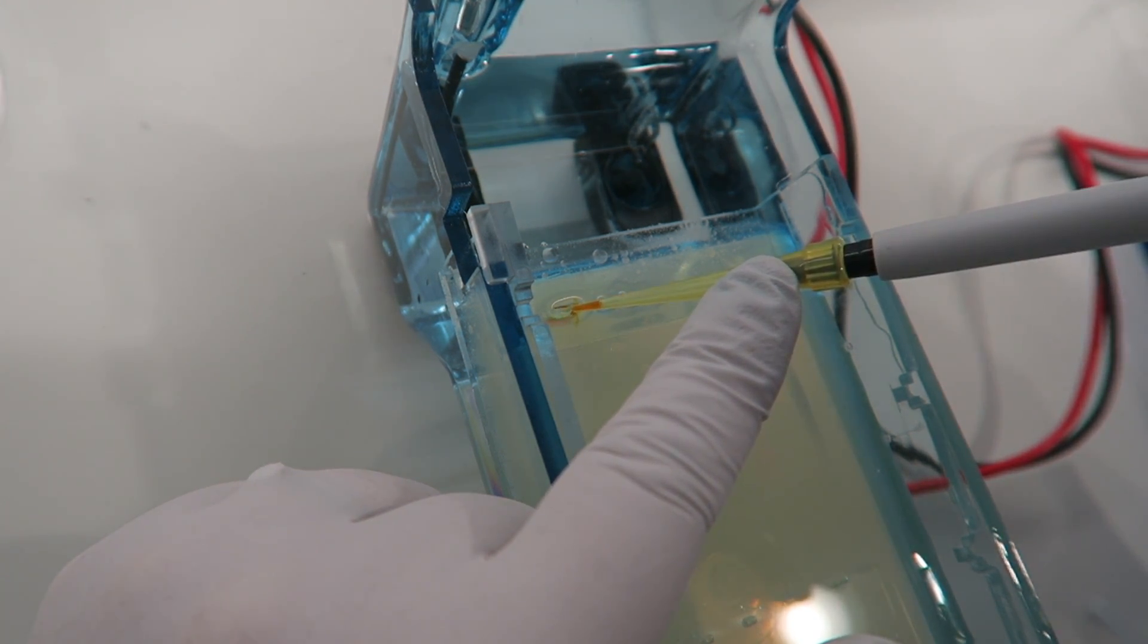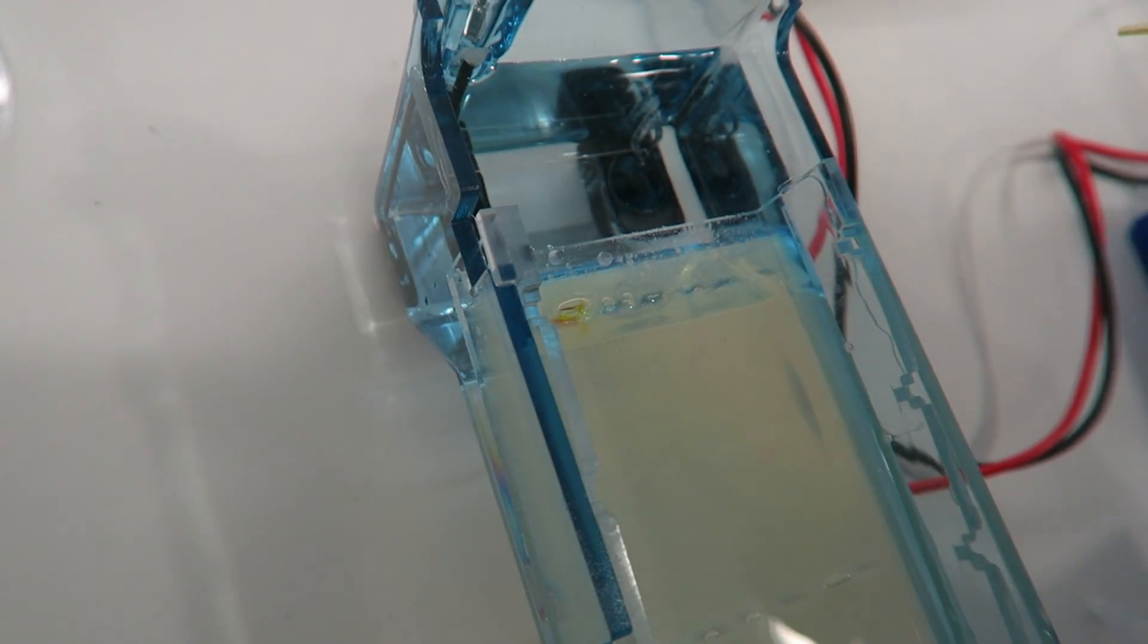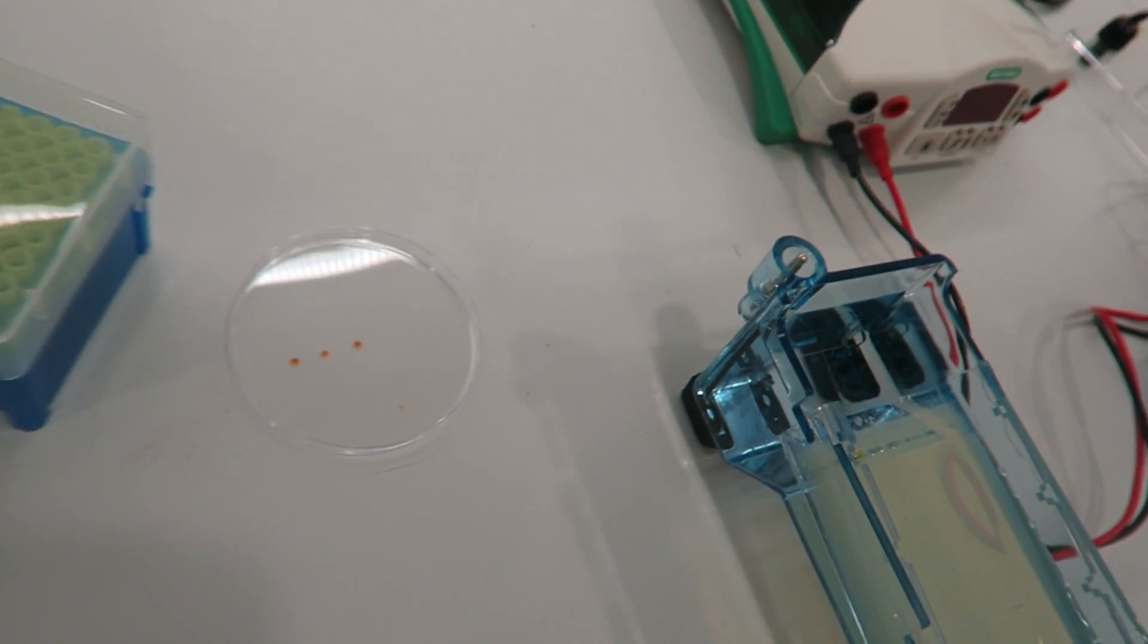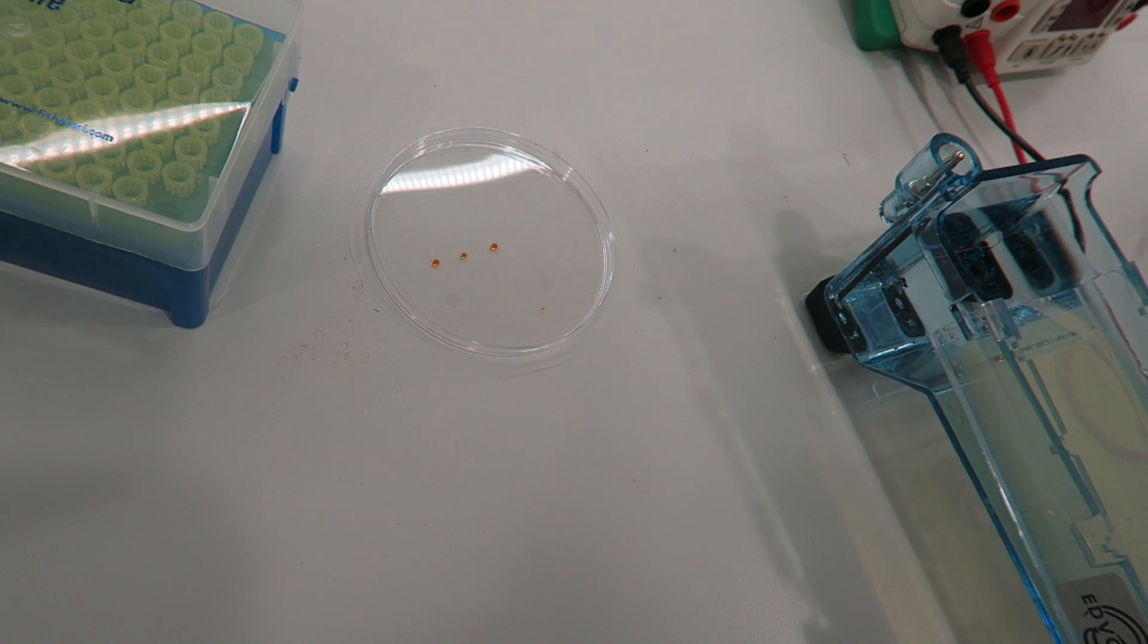It should sink to the bottom and there shouldn't be too much spilling out from other places. You can then change tips and pick up another sample to load.